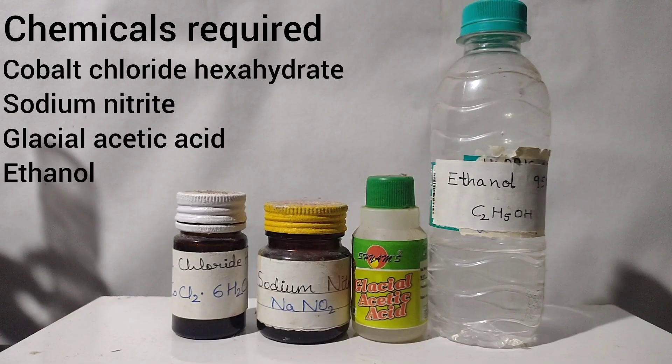For the synthesis, we require cobalt chloride hexahydrate, sodium nitrite, glacial acetic acid, and ethanol.